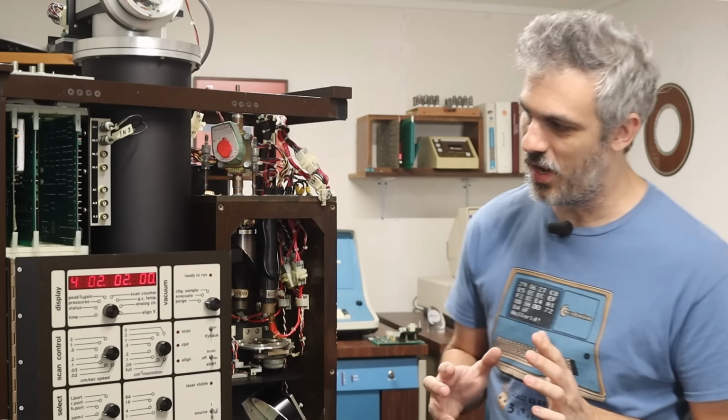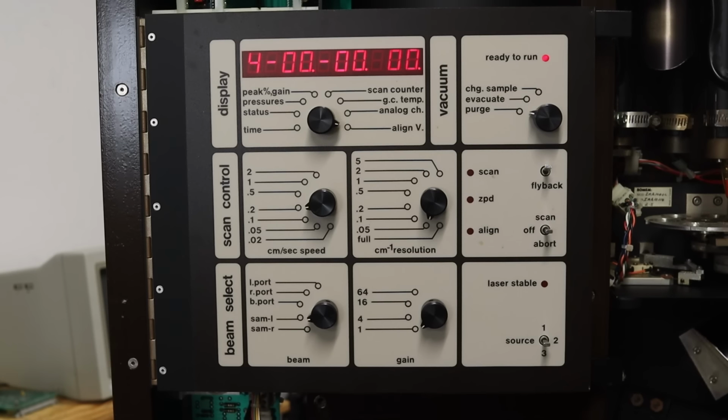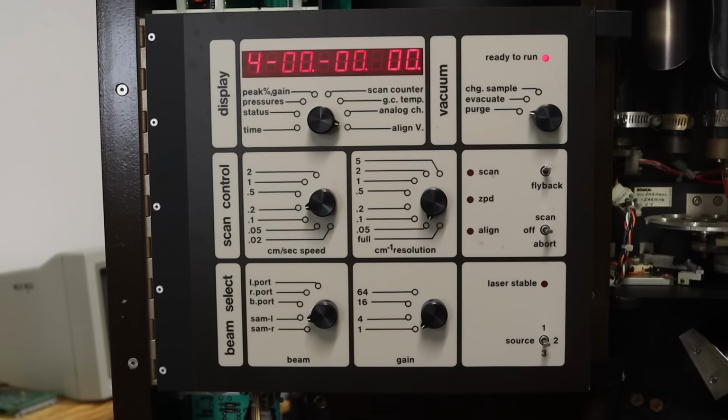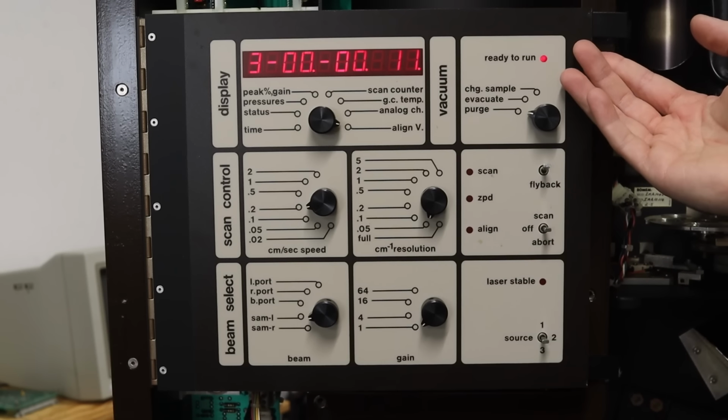Mirrors are moving. We have powered up into mode 4. The laser did come on, that's a good start. Okay, we fully powered up, but you'll notice that the main moving mirror here is not moving, but that's actually to be expected because we're currently in mode 4. When the system's in mode 4, it's just kind of like a standby system. So I need to flip this little toggle switch right here to push us over to mode 3.